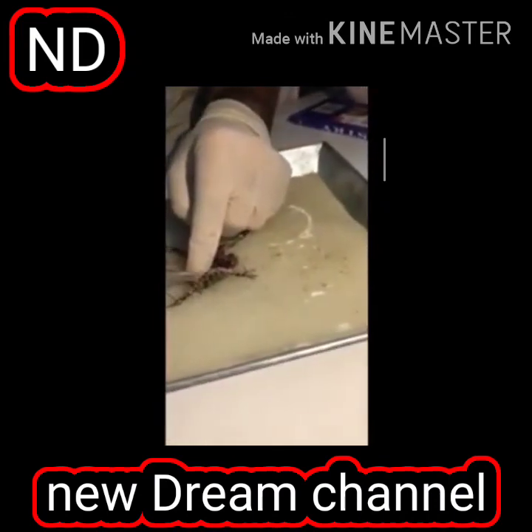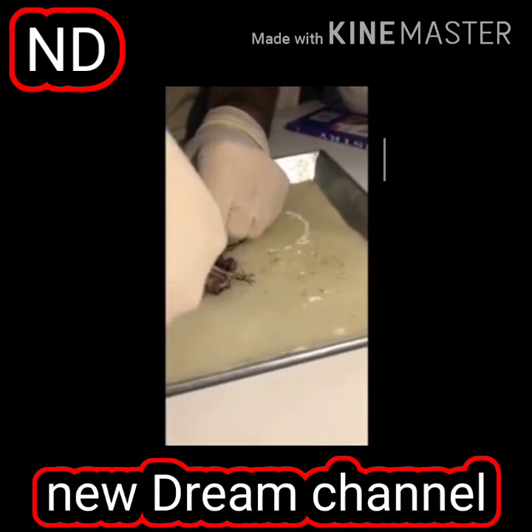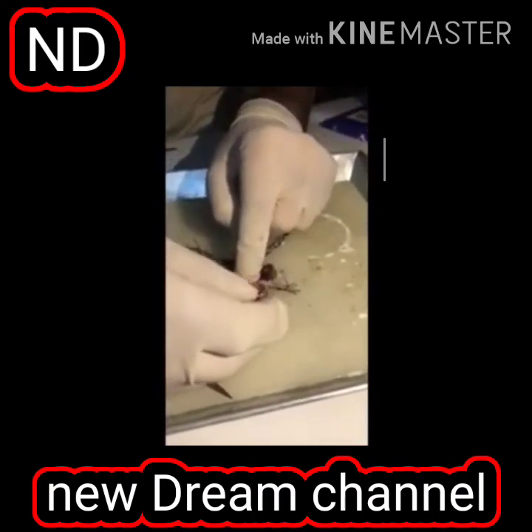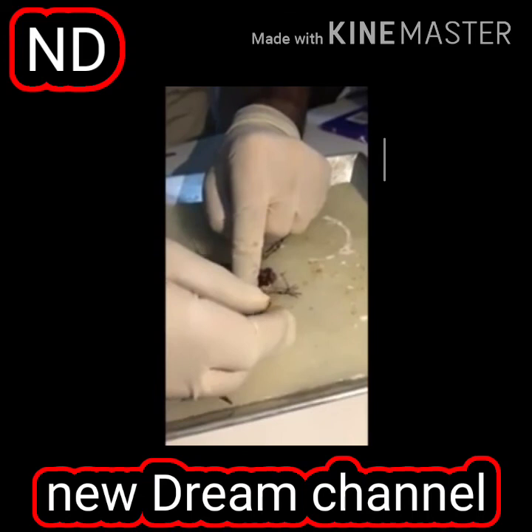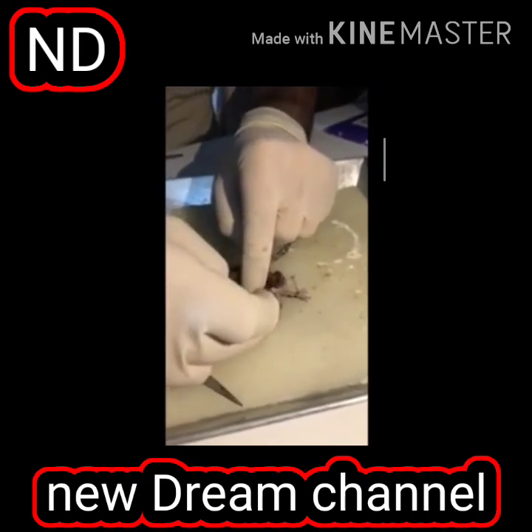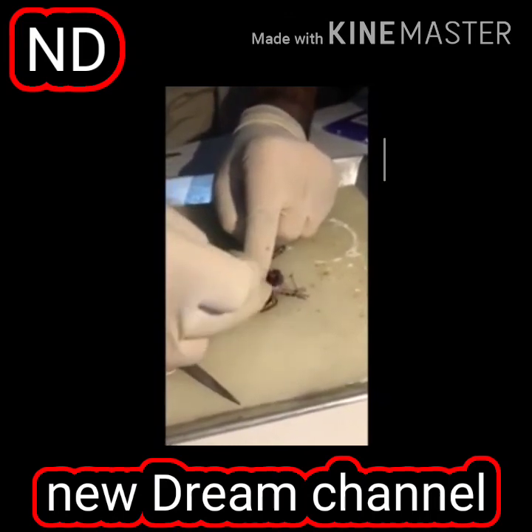This buccopharyngeal lining, I can show you step by step. That's why we see respiration in the frog. That respiration is called buccopharyngeal respiration. It takes this whole lining. That is called buccopharyngeal, and it will enter into the esophagus.